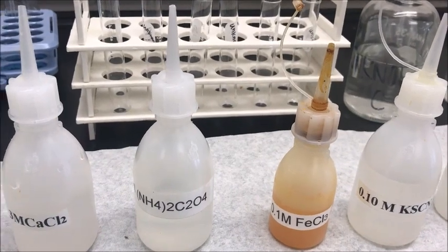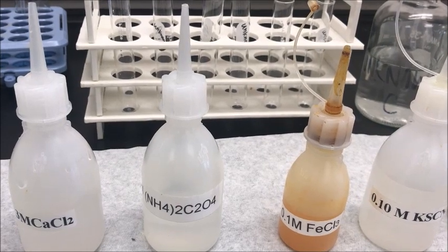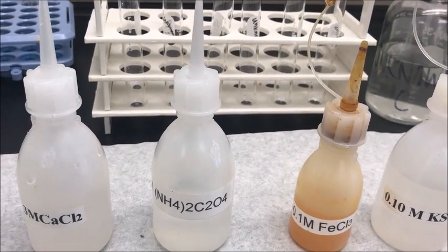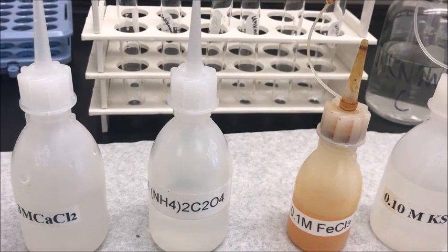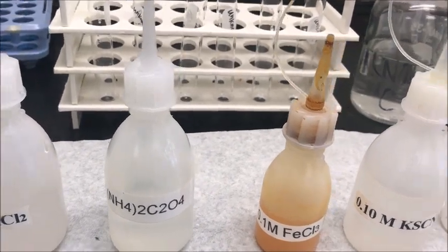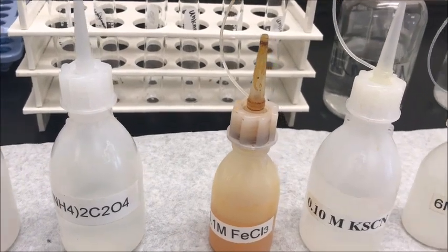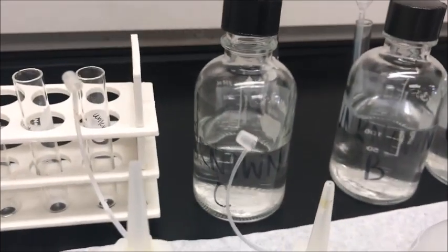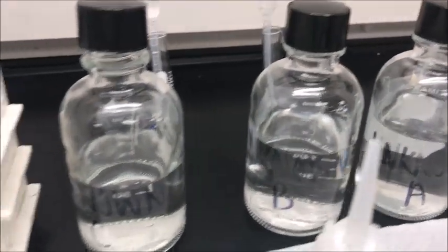We are going to test cations and anions today in this lab. The cations we are going to test are calcium ions Ca2+, ammonium ion NH4+, and iron Fe3+. We also test for an unknown solution along with it.